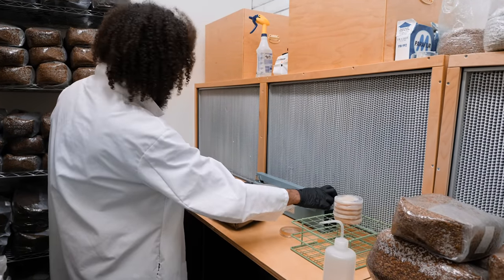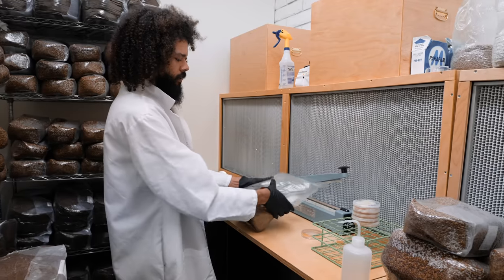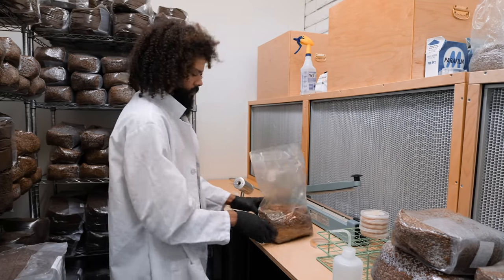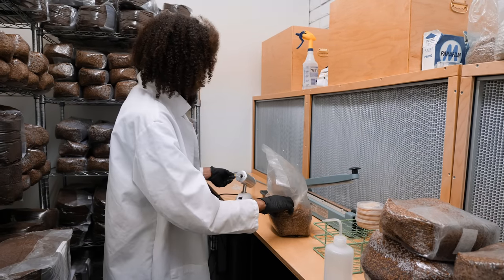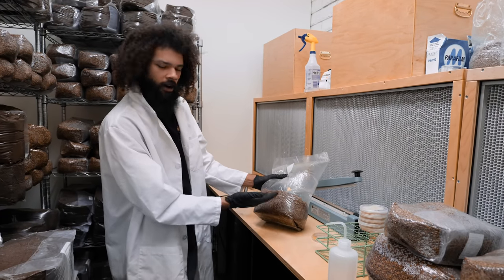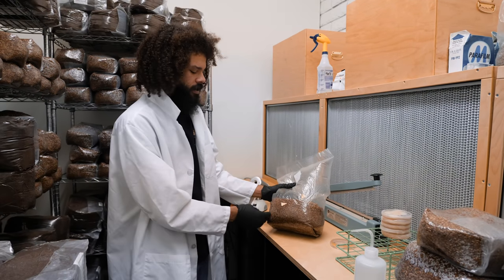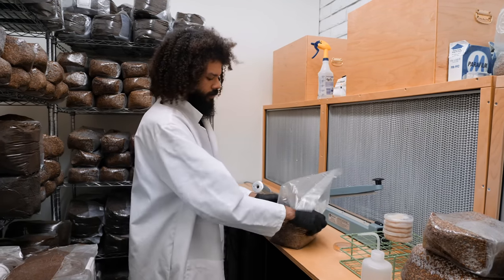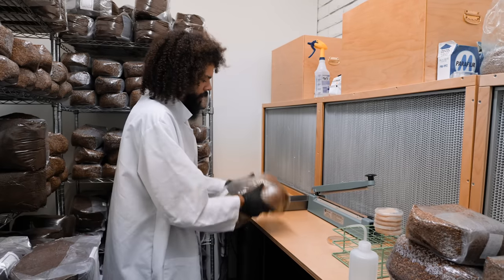When conducting my inoculations, I try not to breathe directly — I breathe through my nose, not through my mouth. While I'm transferring, I try to hold my breath in between transfers so I'm not contaminating my work or breathing bacteria onto my sterile cultures. One thing I like about using bags for grain or tissue transfers is that once you drop the agar wedges into your spawn container, you can break up the tissue further with your hands, which aids in the spread of mycelium.